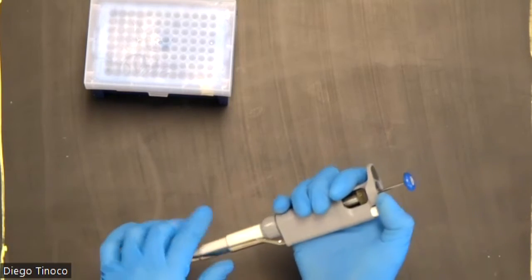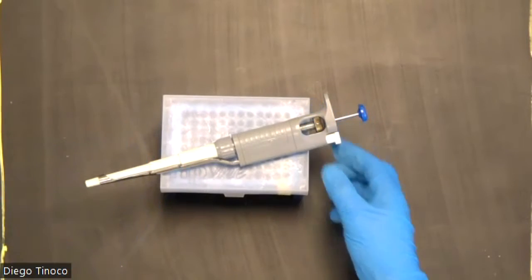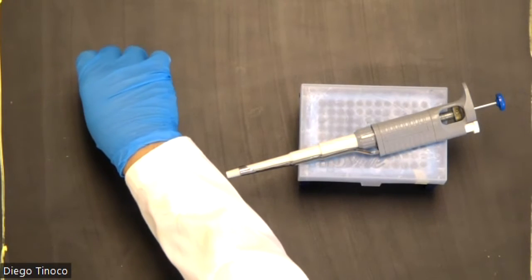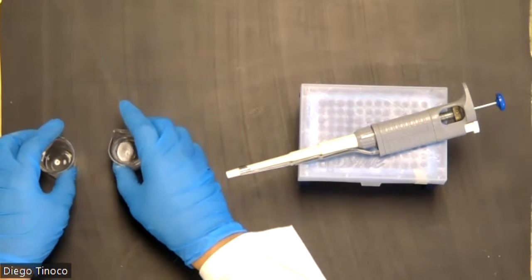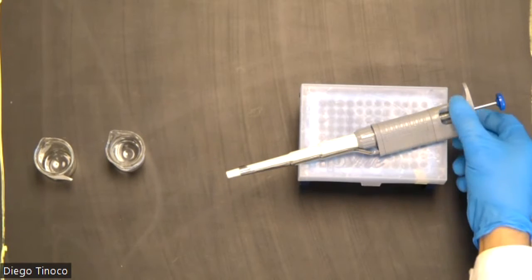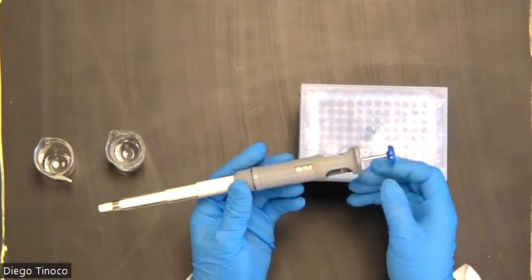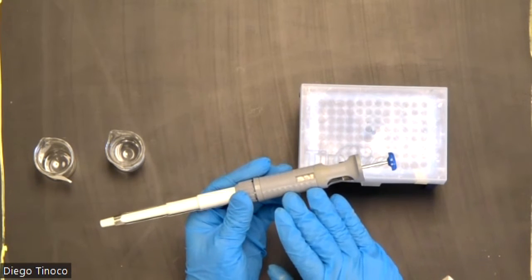Now, in order for me to demonstrate how to actually use it using liquids, I've prepared a small flask with just DI water and another flask to serve as the flask into which we're going to transfer our solution. Before we even transfer any fluids, we have to make sure that our volumetric autopipette is set to the right volume.